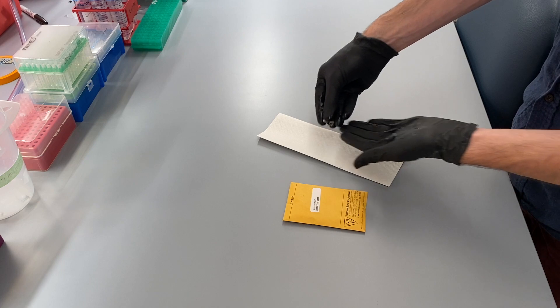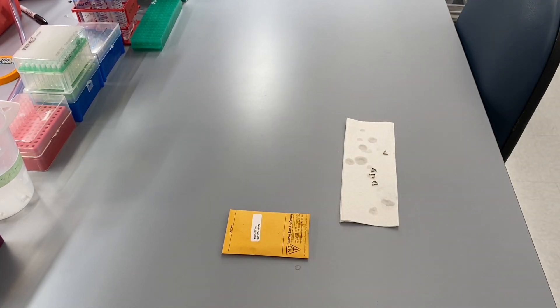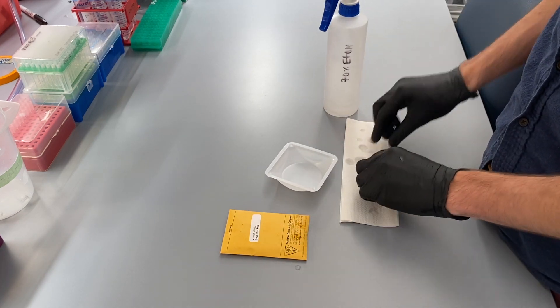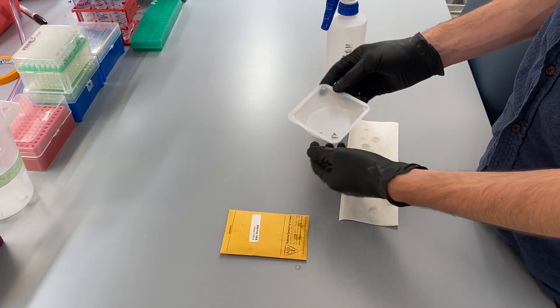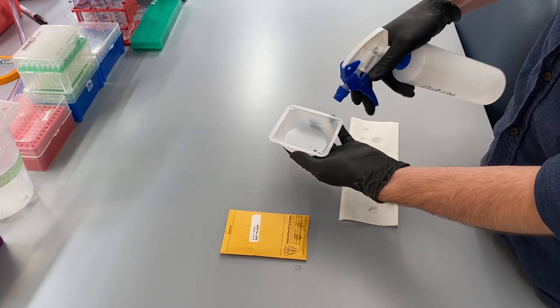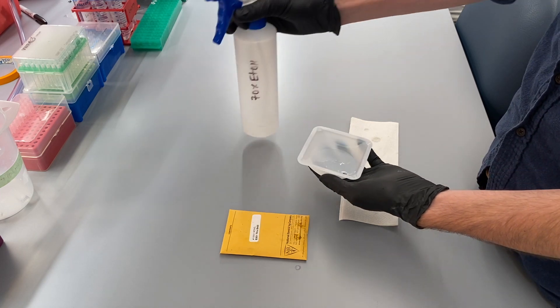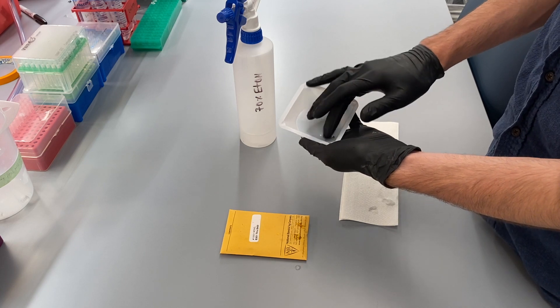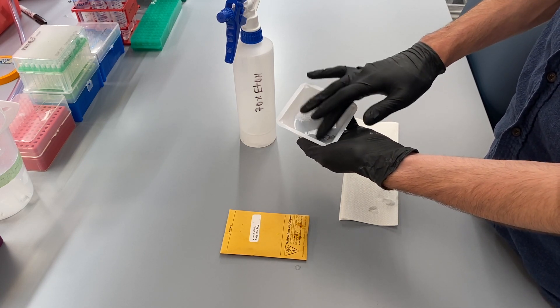After the tags have been thoroughly rinsed, I put them on a paper towel to dry briefly, prior to rinsing them again in 70% ethanol solution. This is a final measure in order to ensure that the opportunity for ear infection is minimized prior to putting these tags into the mouse's ears. The ethanol rinse is similarly thorough in order to make sure that everything is clear, clean, and ready to go.